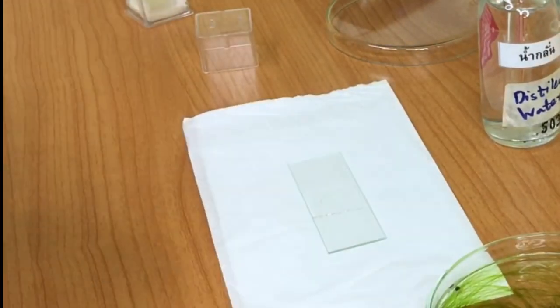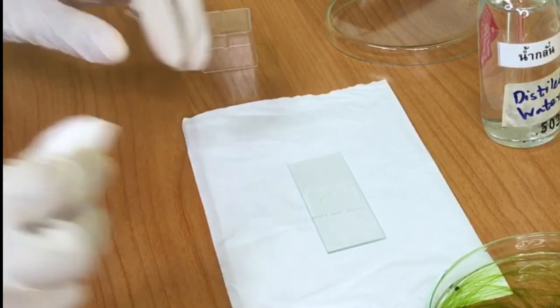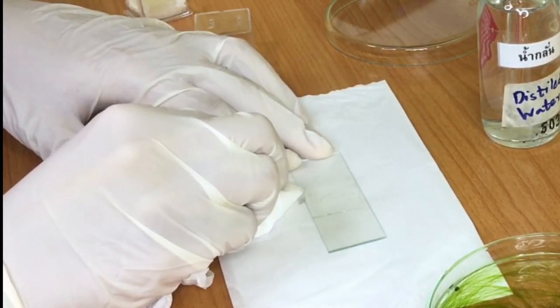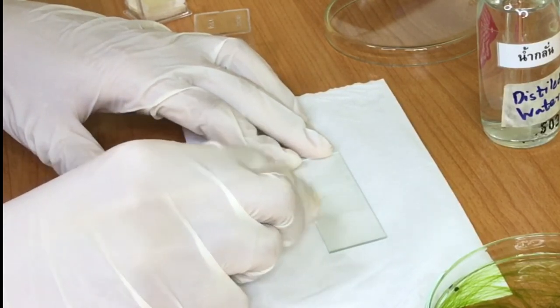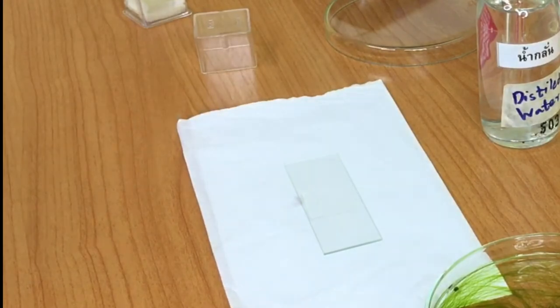After that, remove excess water with a tissue paper. Finally, the specimen is now ready to be observed under the microscope.